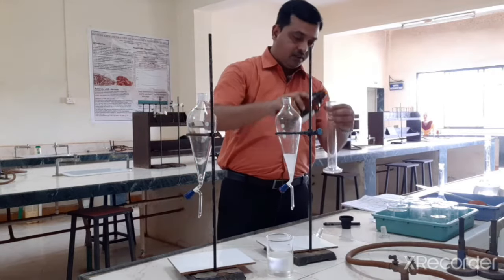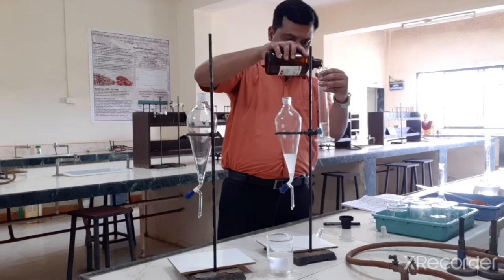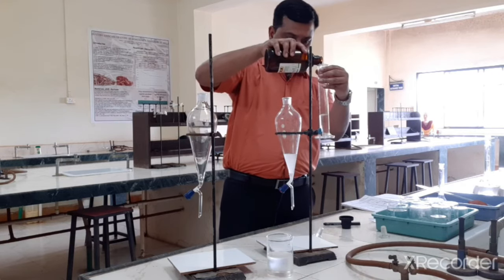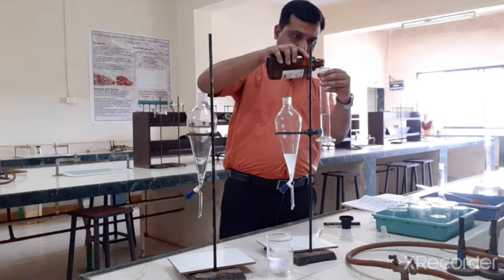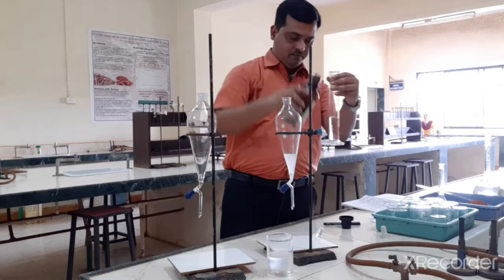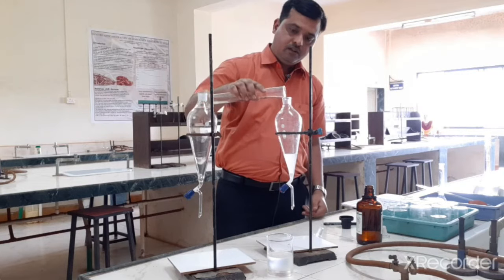Now this is the last one. Again I will take 50 ml of chloroform. And I am repeating the procedure.